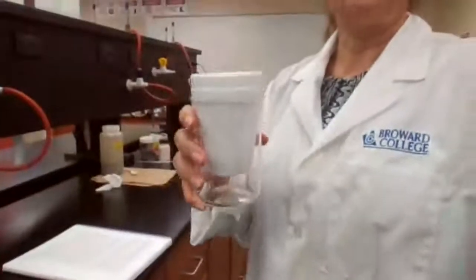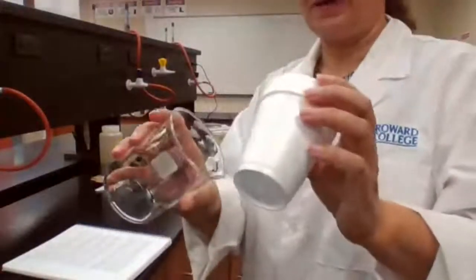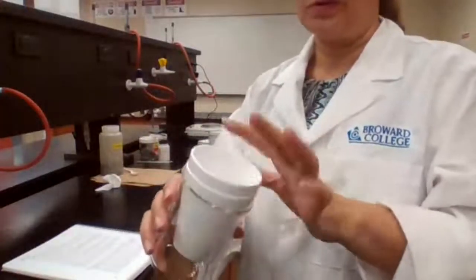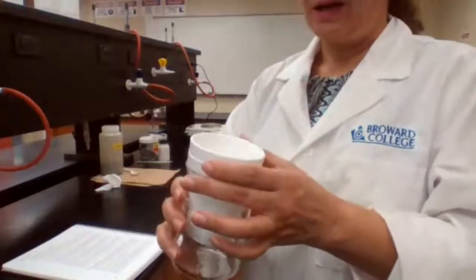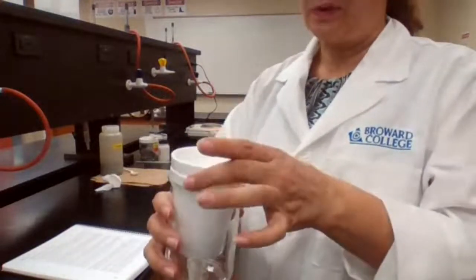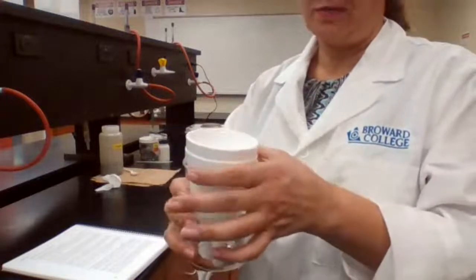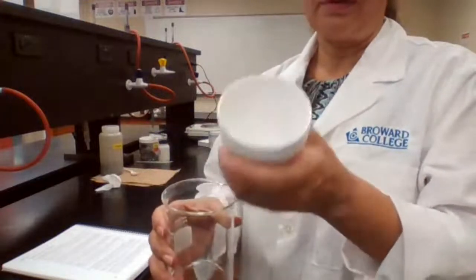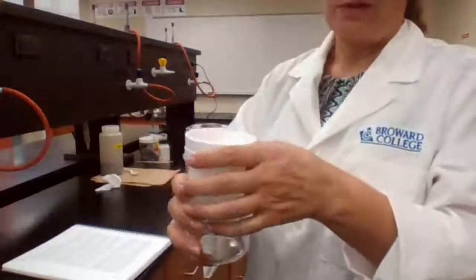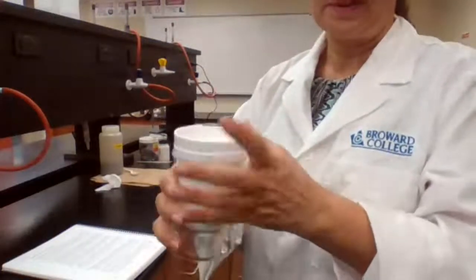Step 1, which is the calibration of the calorimeter. The calorimeter that we are using is a homemade one, like in-house. We have the beaker just to support it because this is lightweight. I don't want to put solution in there and it drops and breaks or spills. So I use the beaker just to support it. I have 2 styrofoam cups. Styrofoam cup is good because that's why you get your hot beverages in a styrofoam cup, not a glass cup without any handle. So it works for the purpose of this.